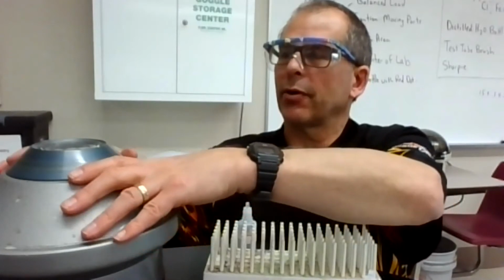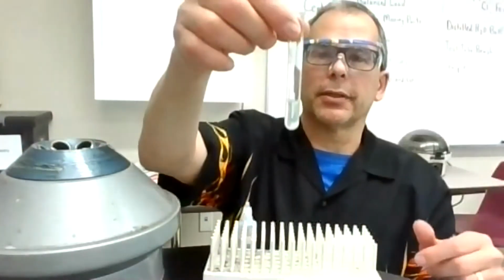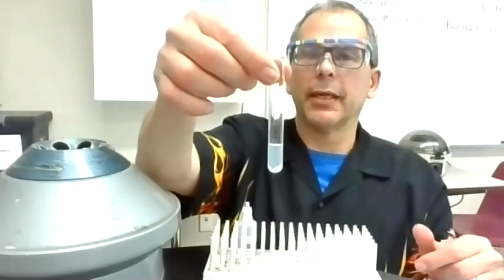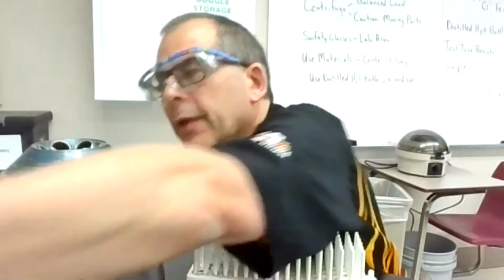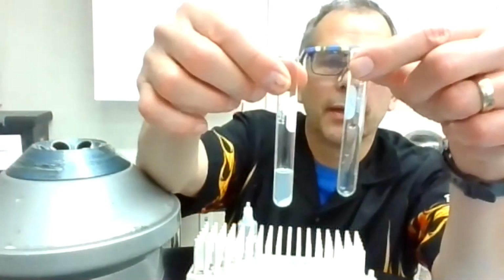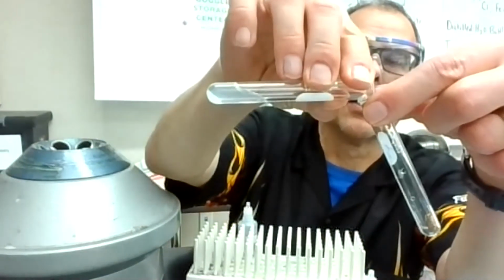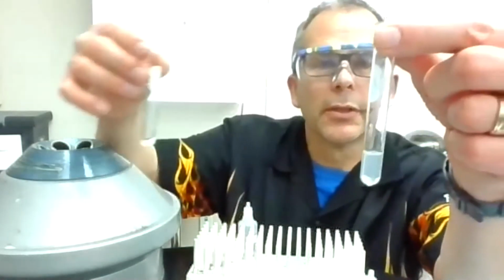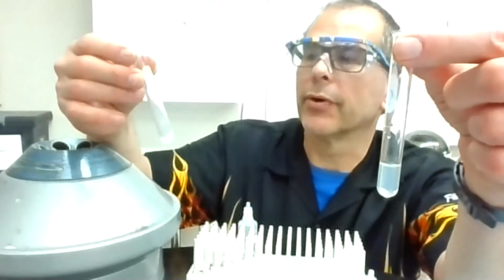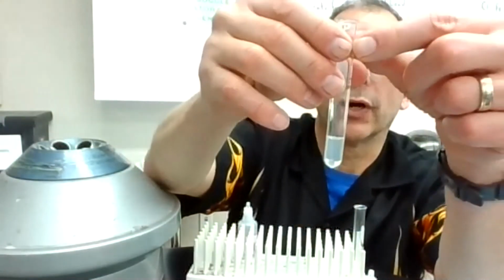Okay, turn that off. I'm going to keep my fingers away from the center where the glass is, but I'm going to slow that down. And well, that looks pretty good. So it looks a little bit hazy, but I can definitely see the solid on the bottom. And I'm going to grab another test tube. And yeah, I see there's some haze left, but I definitely see the solid at the bottom. And that should be okay. It's a pretty good separation. So even though there's some haze there, you can see through it, and there's the solid that was left at the bottom. So now I got this haze, and what am I going to do there?